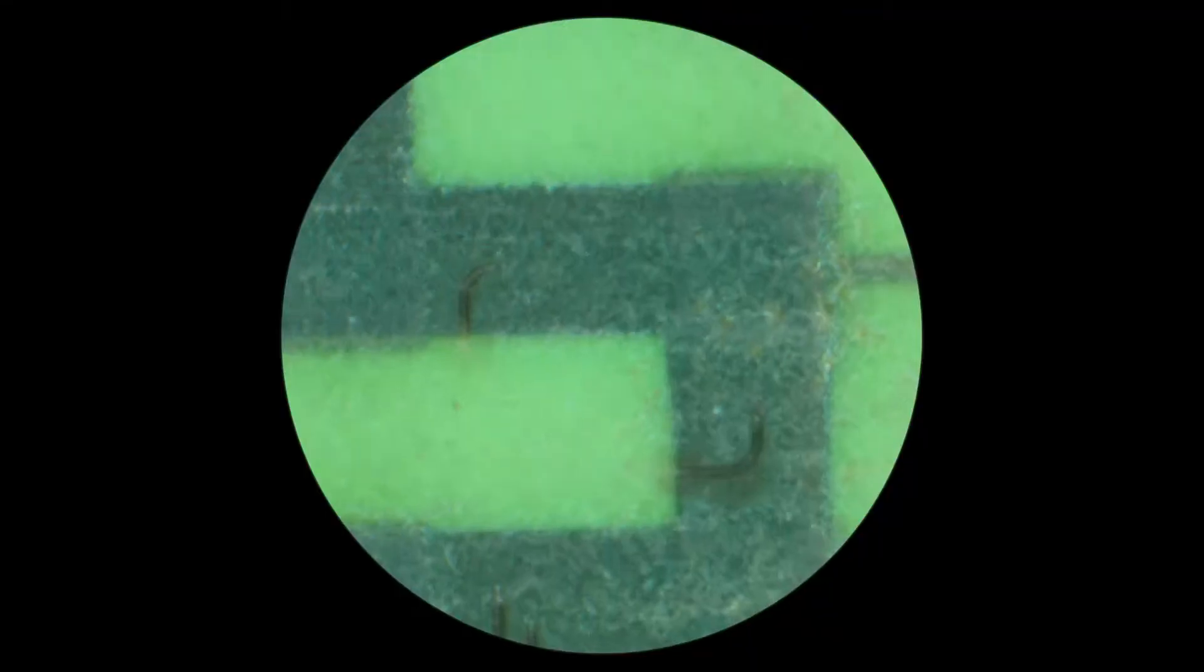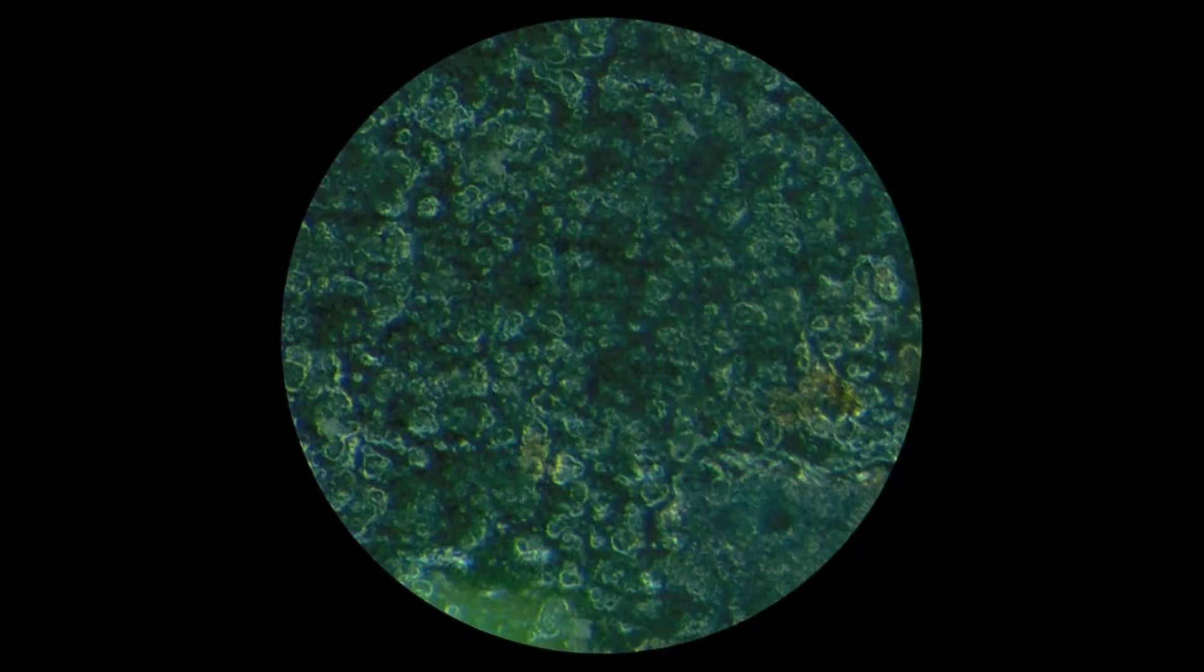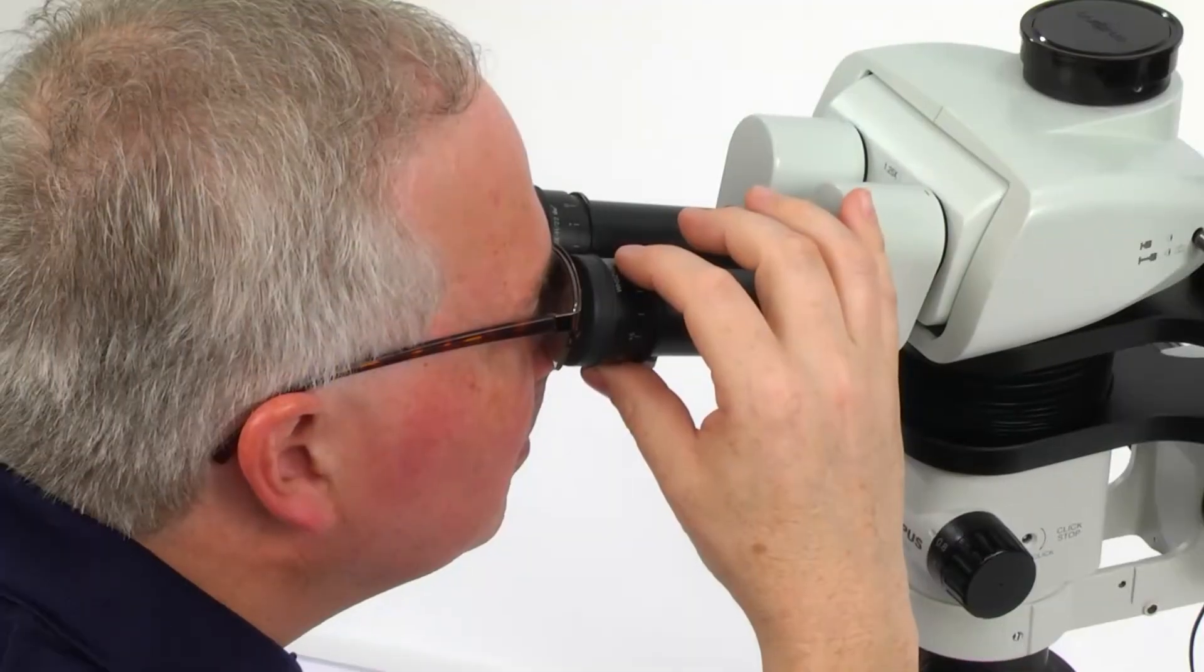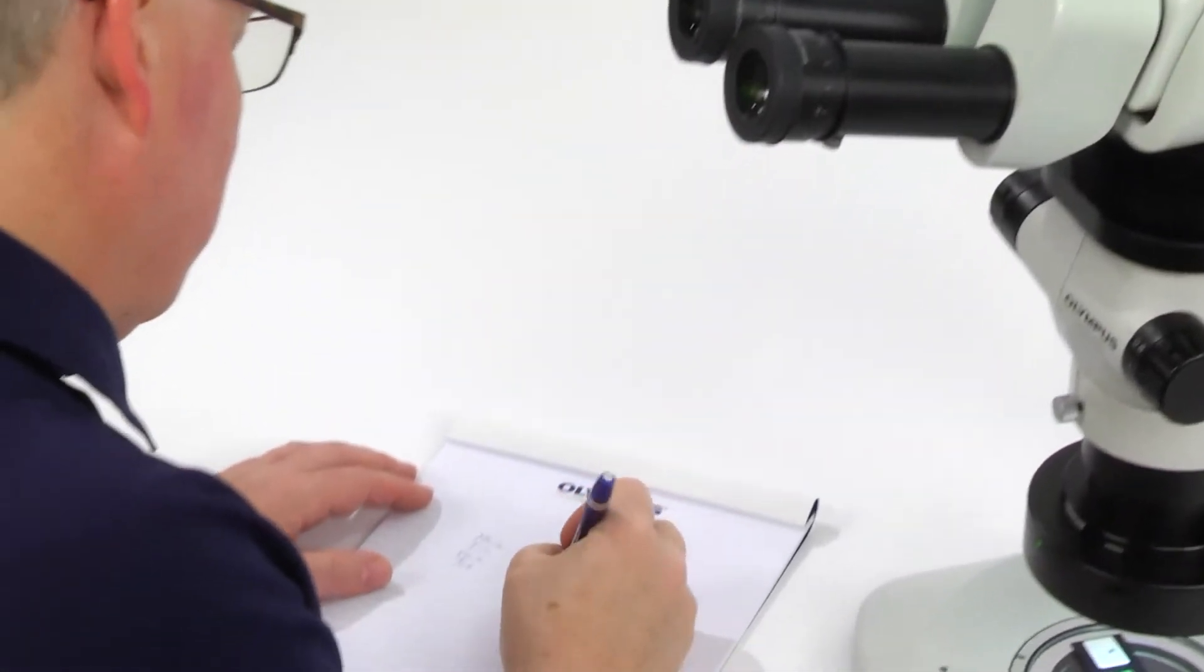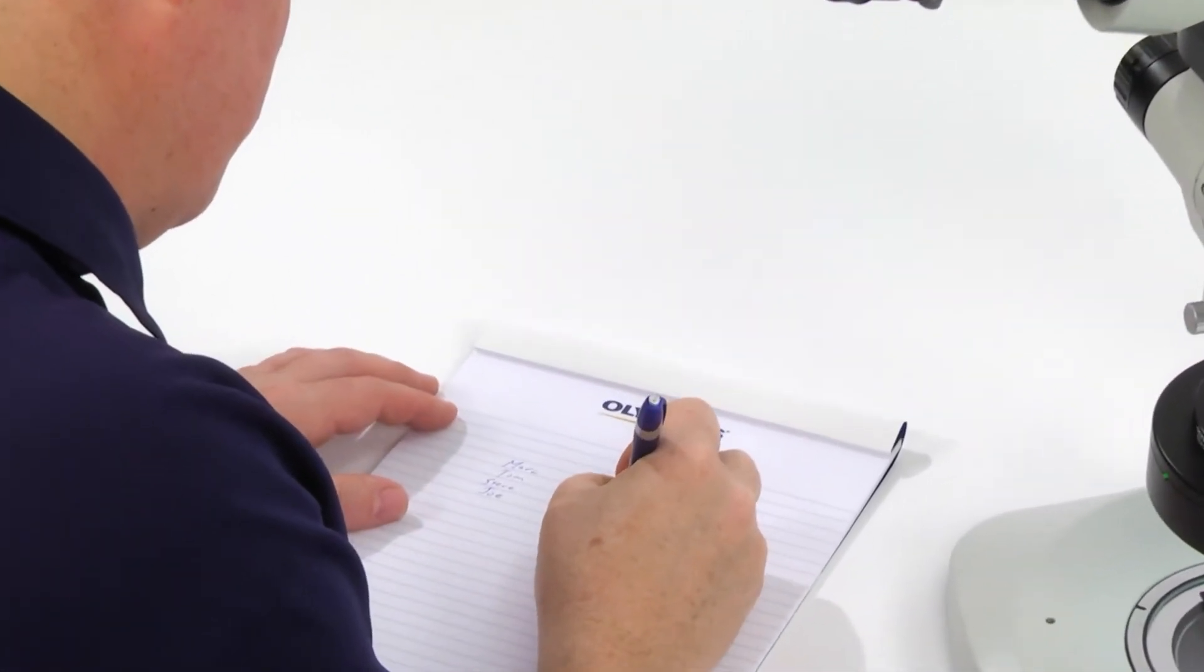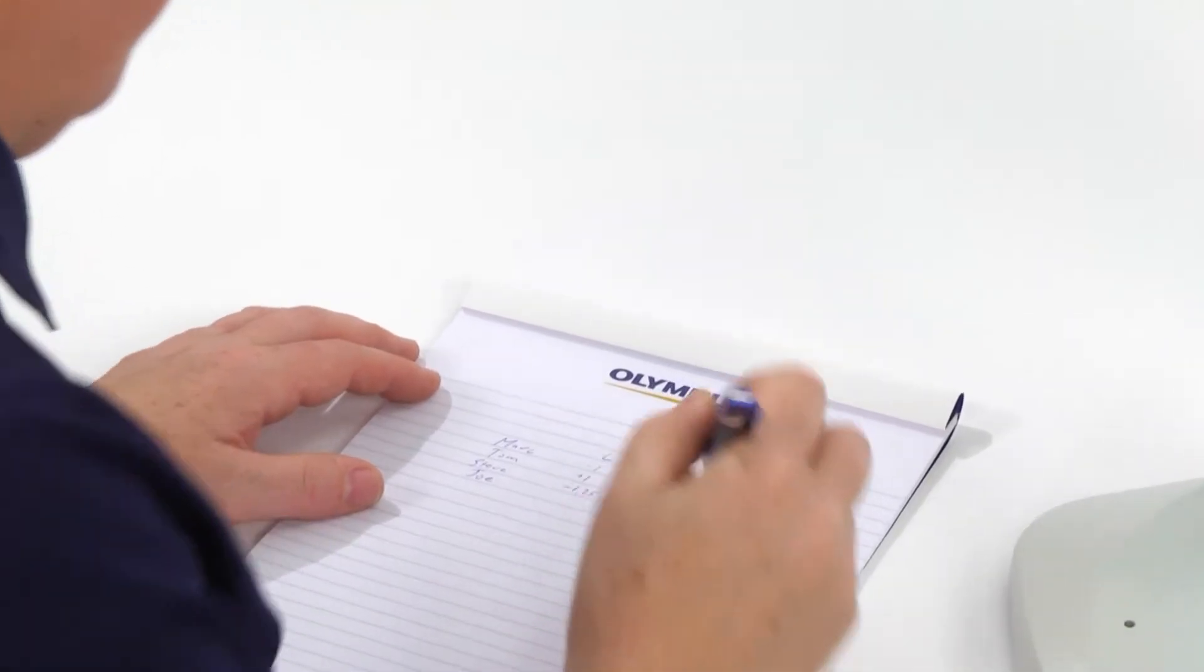The adjustment is now complete and the image should now remain in focus from low to high zoom magnification. For stereo microscopes that are used by multiple operators, Olympus recommends that each operator record their diopter settings since they will vary between users.